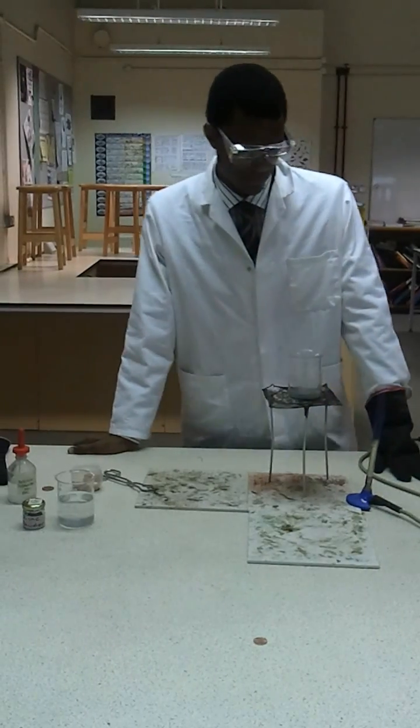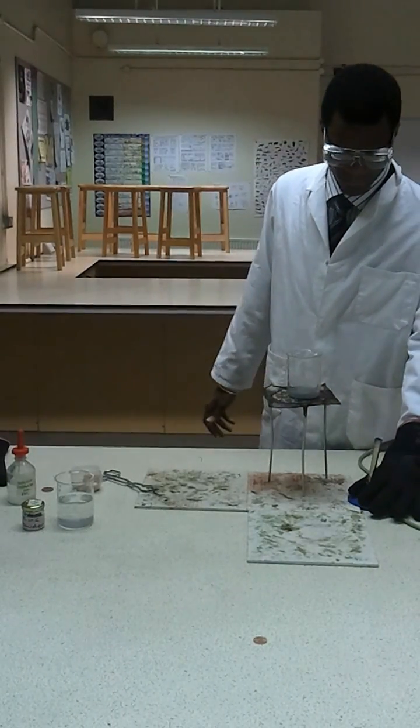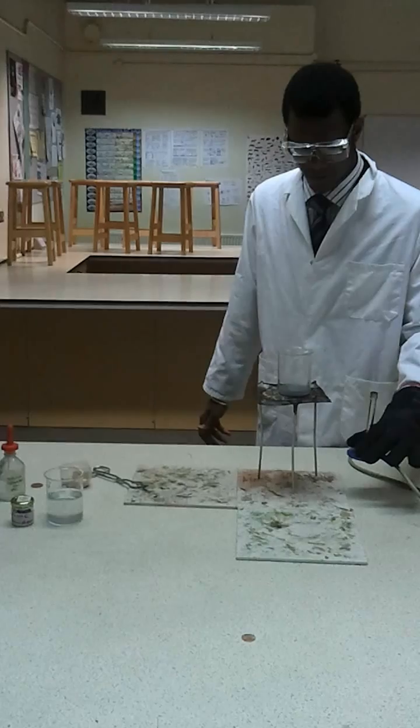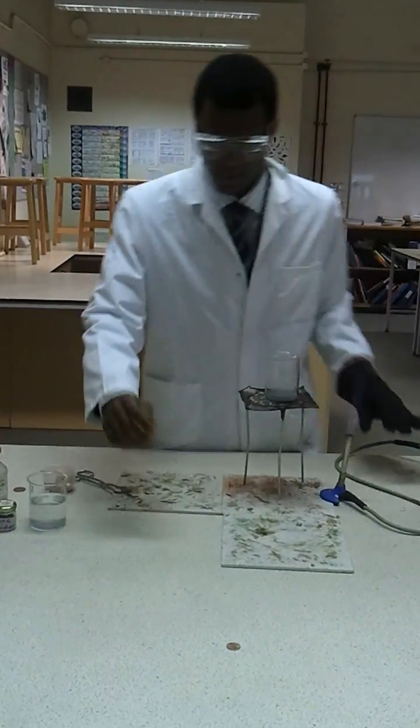Hi, I'm Nasser, a student teacher, and I'm going to do an experiment to turn a copper coin into what looks like silver or gold.